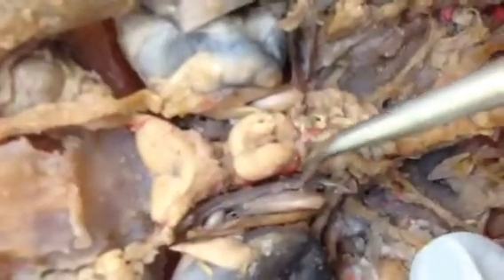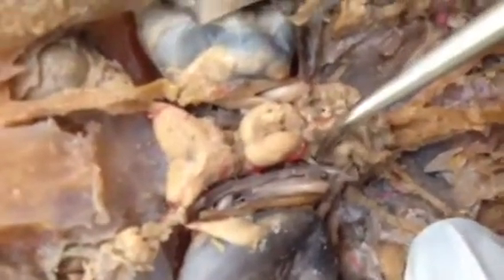Just the mandibular nerve branch off — it's this one. The one that is attached. I've got to focus on it. On mine, if I were asked to verify that, I would try to find it where the mandibular branches are. Oh yeah, you can see it. Okay, here, this one. Okay, good.